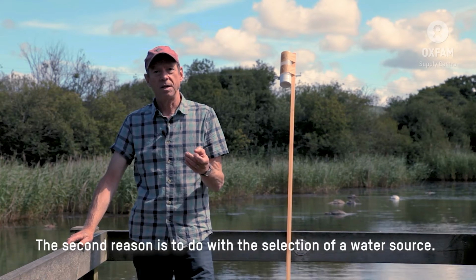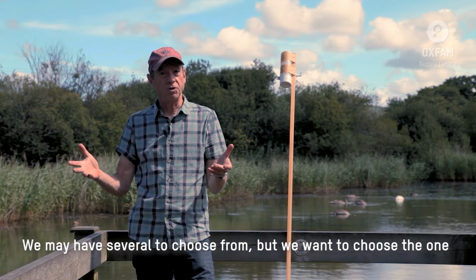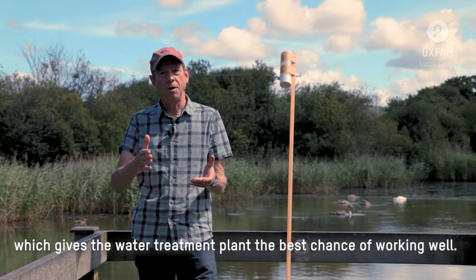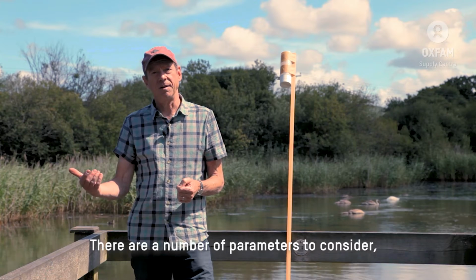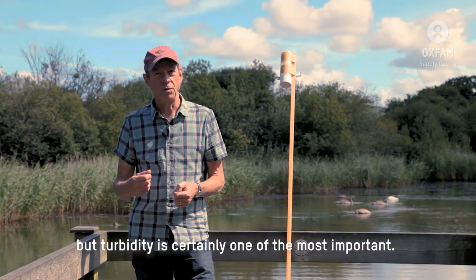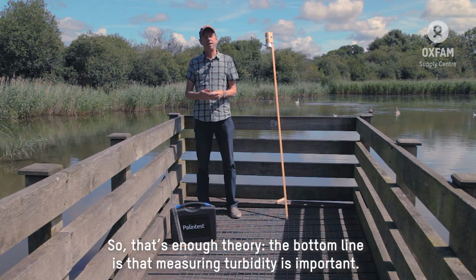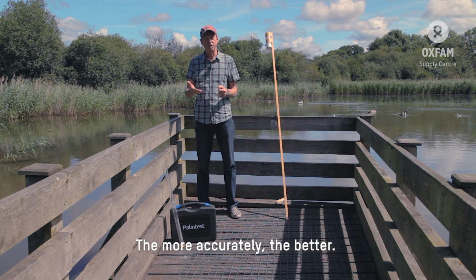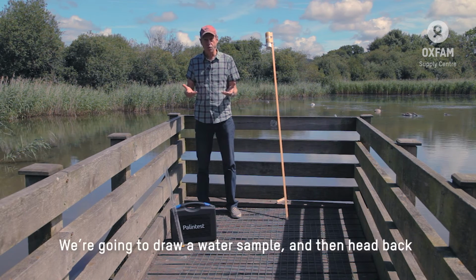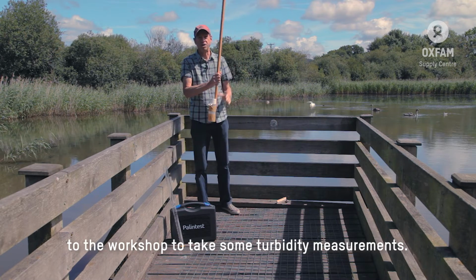The second reason is in the selection of a water source. We may have several we can choose from initially, but we want to choose the one which gives our water treatment plants the best opportunity to work well. There are a number of parameters to consider, but turbidity is certainly one of the most important ones. So that's enough of the theory. The bottom line is that measuring turbidity is important, and the more accurate you can do that, the better. So we're going to draw a water sample and then head back to the workshop.